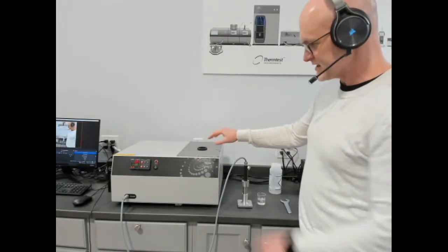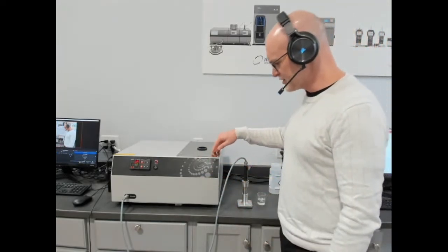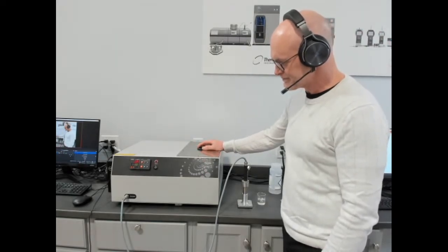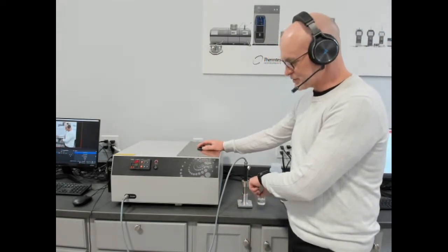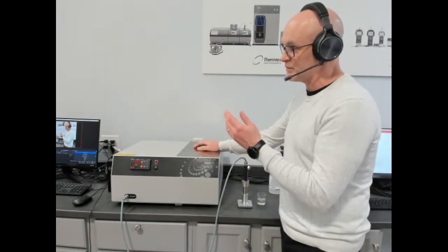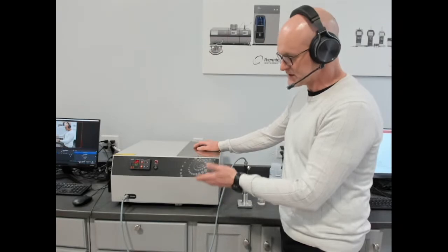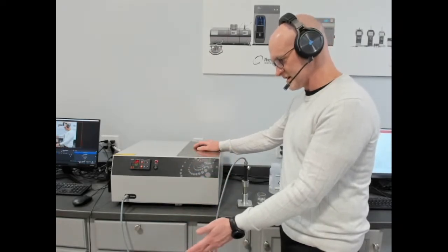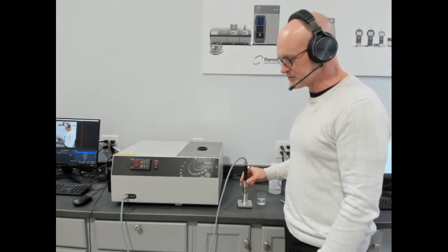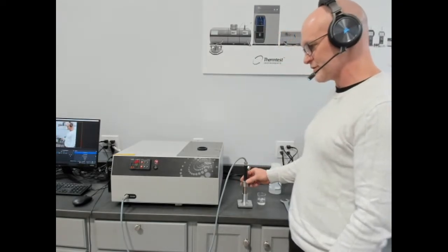This L1 as it is here is our basic unit. This will go from 10 degrees to 200 degrees Celsius and up to a back pressure of 20 bar. We have extended range options that'll go down to minus 45 Celsius and even minus 160 Celsius up to 300 Celsius. And that extended range also allows for back pressure up to 35 bar.